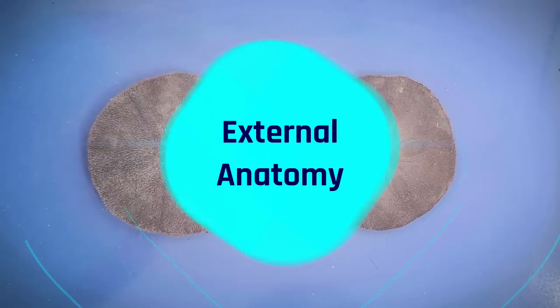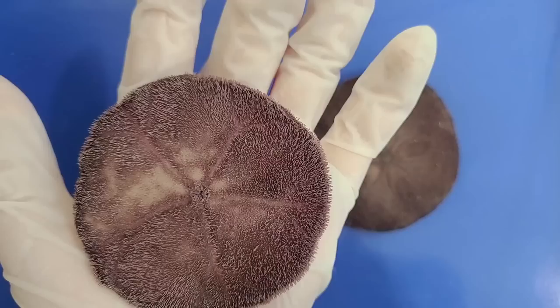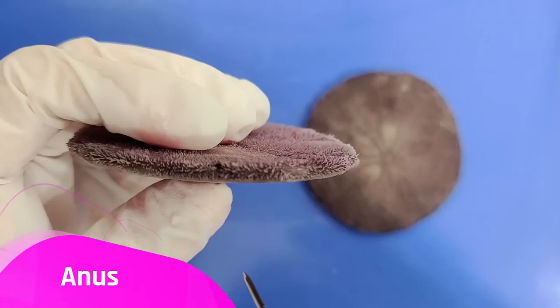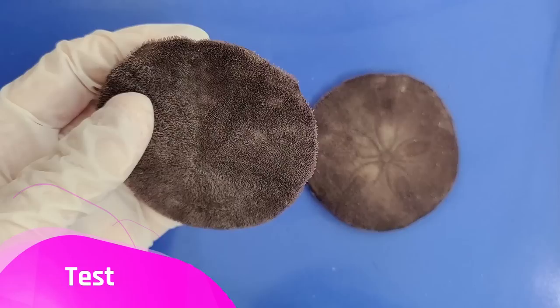Now let's take a look at the external anatomy. This side right here is called the aboral side, while this side where the mouth is located is called the oral side. Unlike sea urchins, sand dollars don't have their anus on the aboral side — rather, it's on the side, right here. This hole you see is the anus.